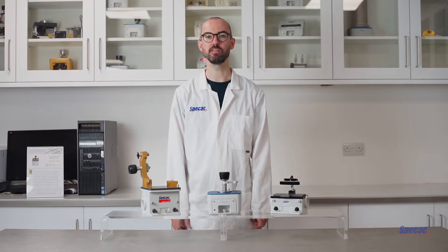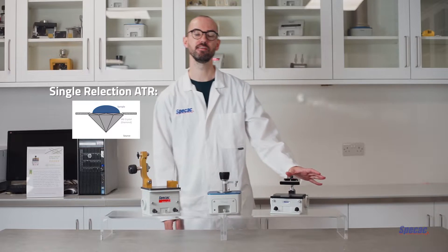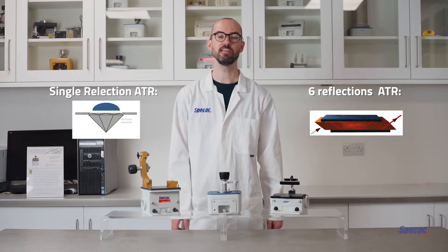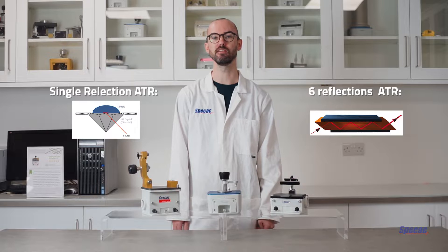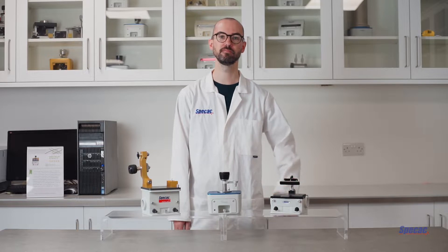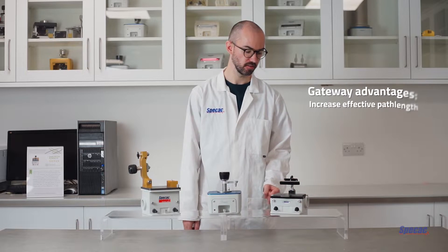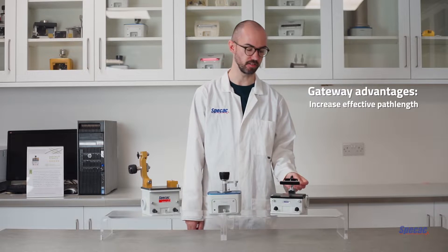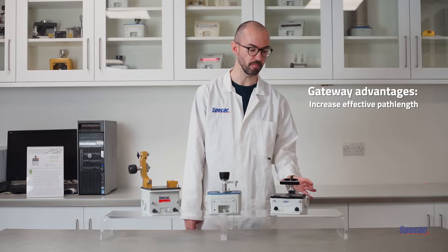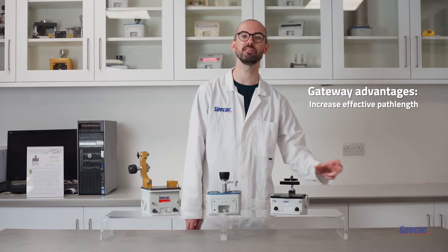The first major difference between these accessories is that the Golden Gate and the Quest are both single reflection ATR devices, whereas the Gateway is a six reflection ATR. This means that for the Golden Gate and Quest, each ray of light contacts the sample only once as it reflects off the internal reflection element, whereas for the Gateway there are six points of contact for every ray of light. For a multiple reflection device like the Gateway there are really twofold advantages. The first is that with multiple points of contact we increase the sensitivity. We can describe this in terms of an increase in effective path length, but we should remember that more points of contact does not imply that the beam is penetrating to a greater depth — it's simply at more places in the sample.